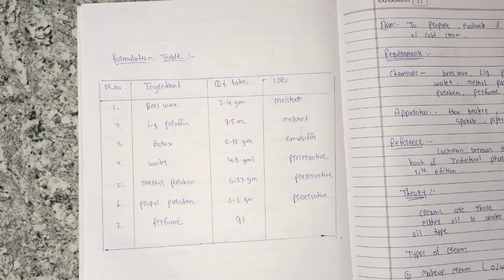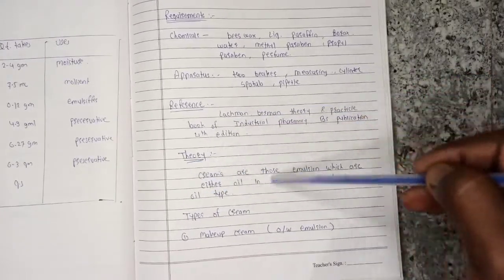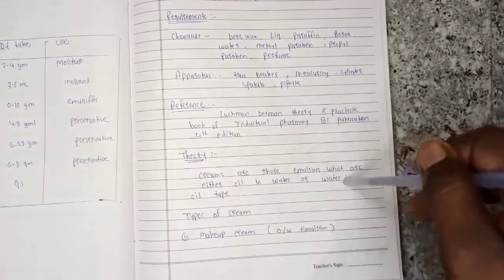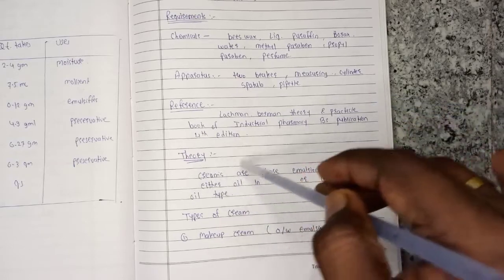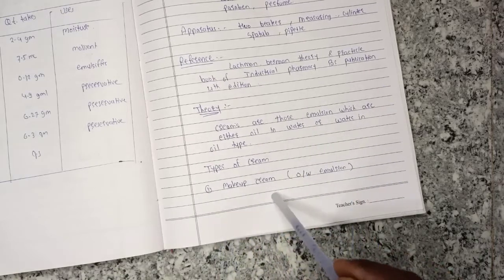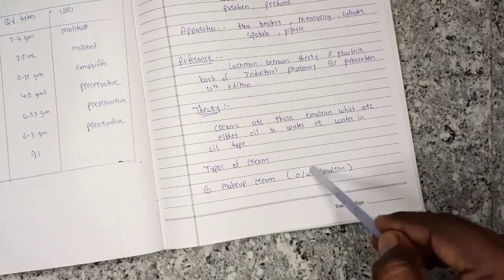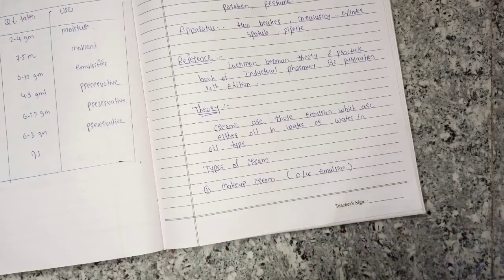We have seen this formula table. After that, we will see a little theory part — which types of creams exist. Creams are emulsions, either oil-in-water or water-in-oil type. An emulsion is a mixture of oil and water. In make-up creams used in the cosmetic industry, the quantity of water is increased and oil is reduced, so that the makeup is applied on the skin.